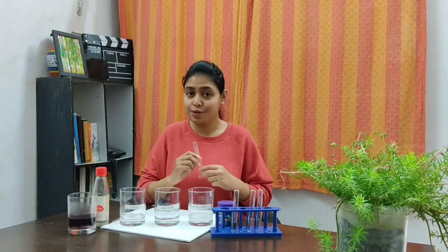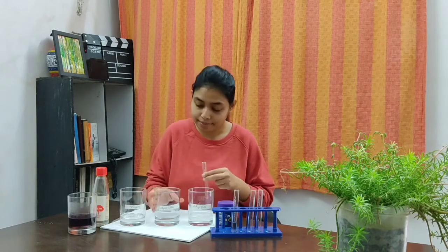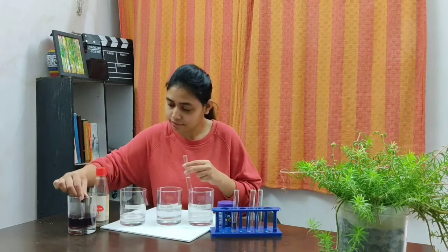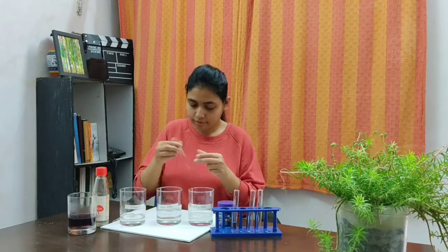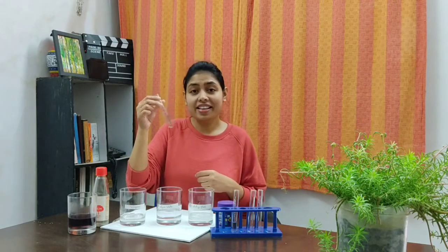Now in the second test tube, I will pour some sugar water solution, which is a neutral solution. Children, you can all see that there is no change in the color of the indicator, as it is a neutral solution.